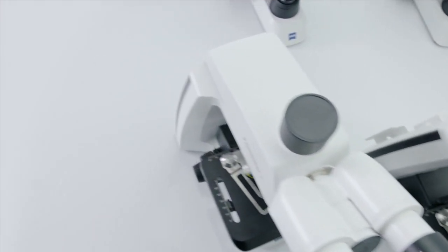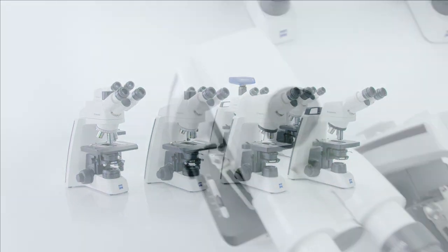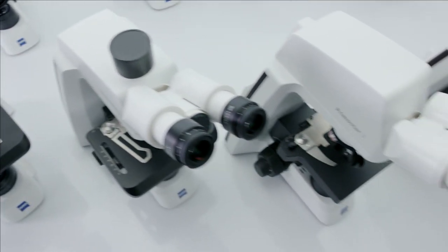It's your choice, and the best thing is, you don't have to choose. They're both entirely interchangeable. Here's how it works.